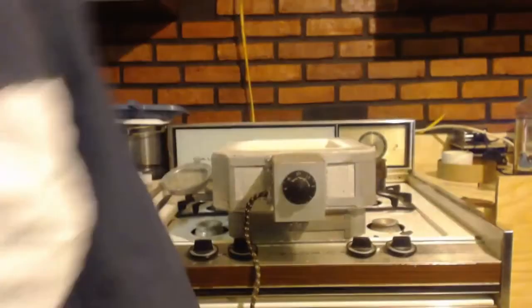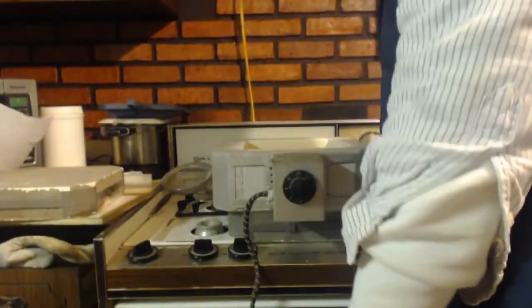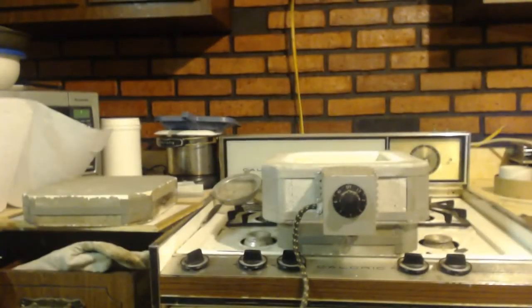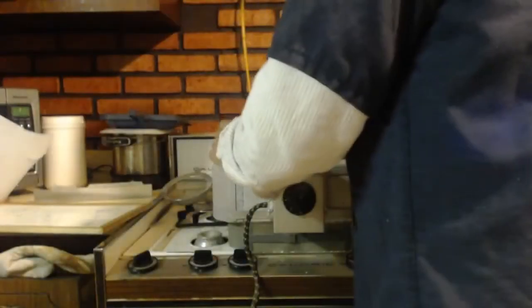See, I got different layers here I can take off. Got my thing. Put it right in there. Okay. Cap it up. And plug it in.